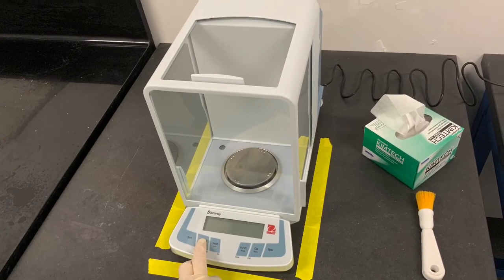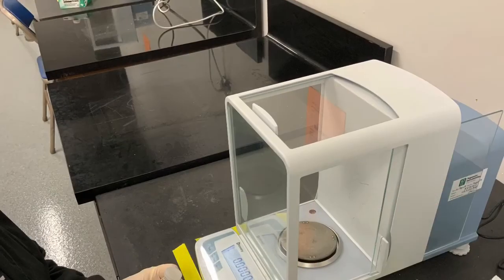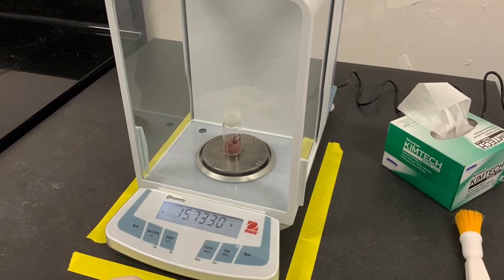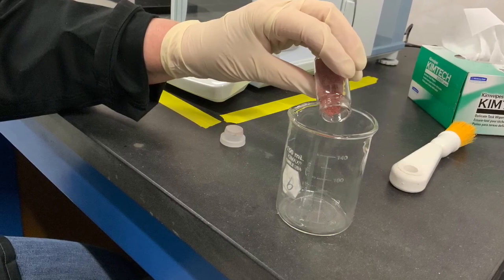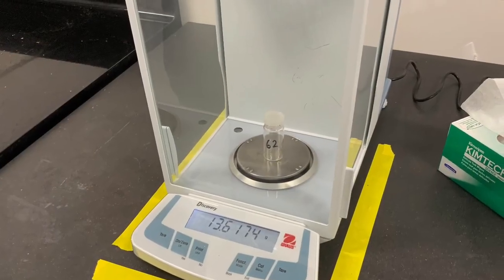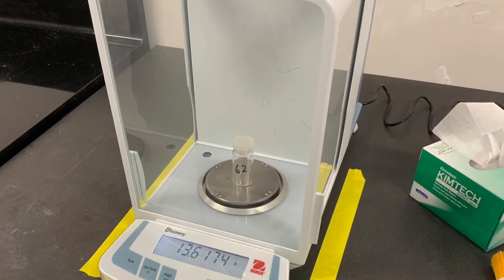First, we need to determine the mass of our sample, and therefore we go to an analytical balance. We turn it on, tare it to start with exactly 0 grams, and then place the container with our sample on the balance. We record the mass and then transfer all the substance into our reaction container, a 150 milliliter glass beaker, and then the empty container is weighed and the exact mass is recorded. The difference between these two masses is of course the mass of our sample.